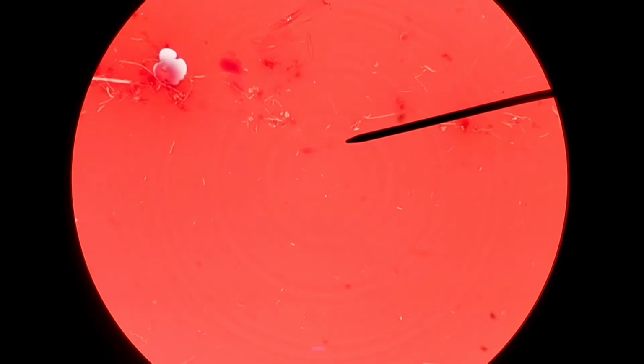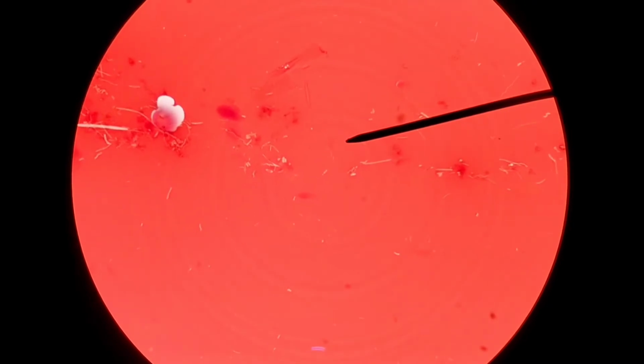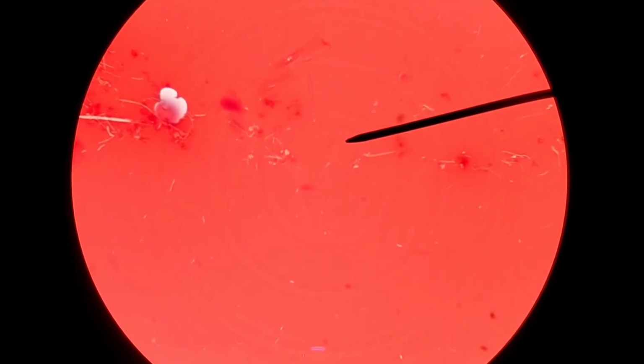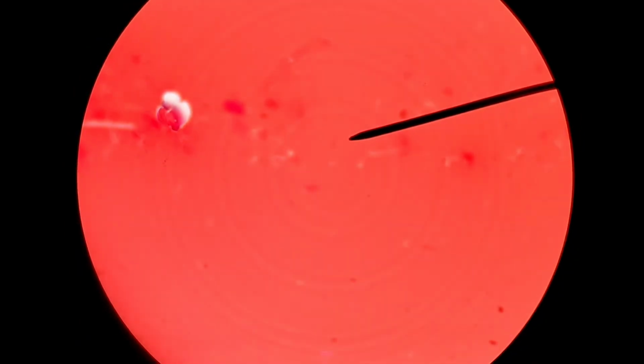I confess that this is not mine, and part of the reason is because I had looked through mine moments ago, and I didn't find anything as interesting as a spirochete, so I wanted to take the time to show you. This is from a student some years ago. I know I had told that story about some of my students having found them, and they are findable occasionally in people's oral cavity.